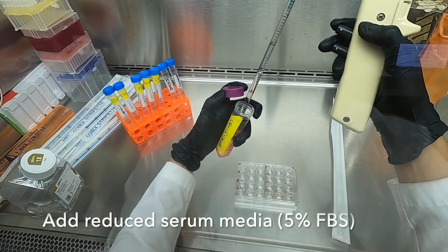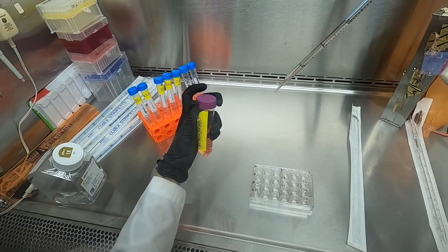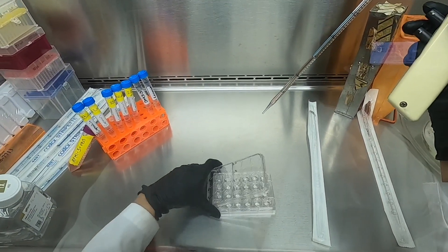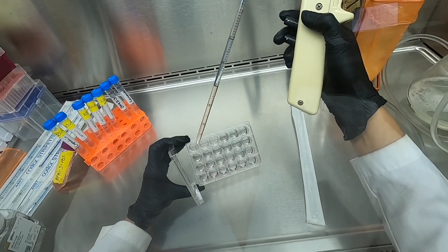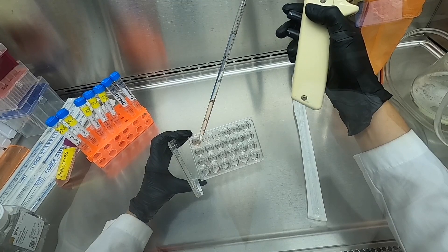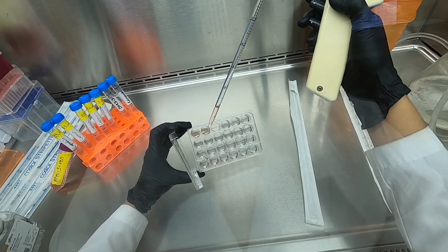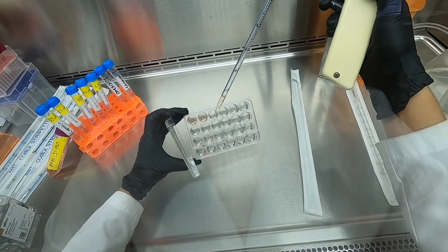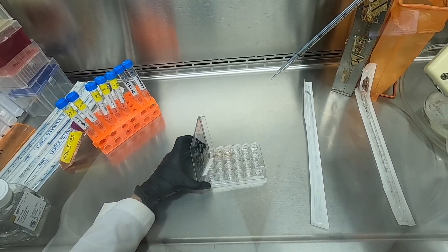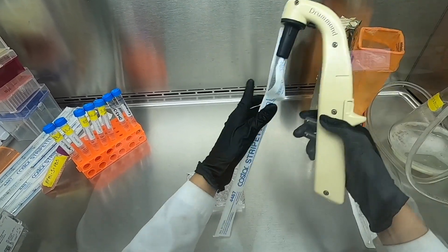The first solution we will be adding is regular cell culture media, RPMI, but instead of containing 10% FBS, it contains 5% FBS. It is important to use low serum media when working with wound healing assays. A reduction in nutrients allows the cells to remain alive, but it also allows us to focus on cell migration and not cellular proliferation, so we can reduce the variables that will affect our outcome.